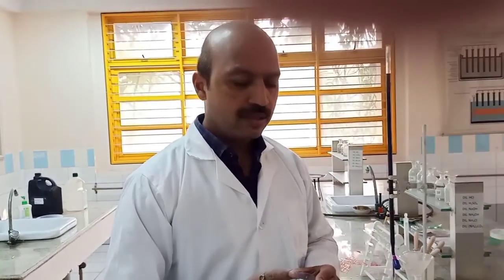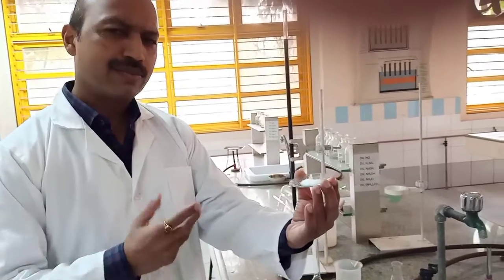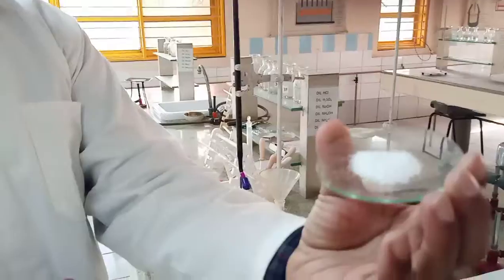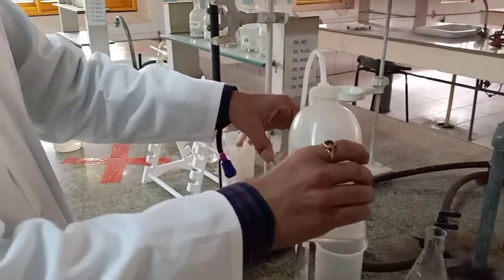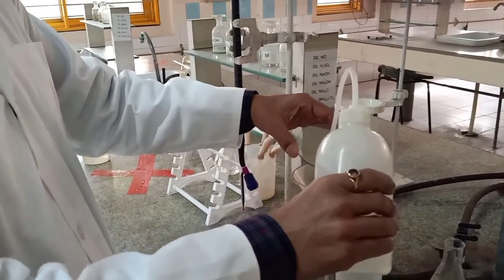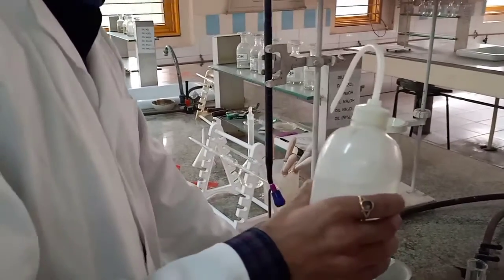Now we go for the next titration, which is in our syllabus, oxalic acid versus KMnO4. Now you can see oxalic acid is a whitish solid. Can you see it? Come close. Right. Now the first step, obviously we all know, is to transfer the oxalic acid, and we don't require adding H2SO4 because there is no point in getting it hydrolyzed with the help of water. So you already know how to transfer it carefully.